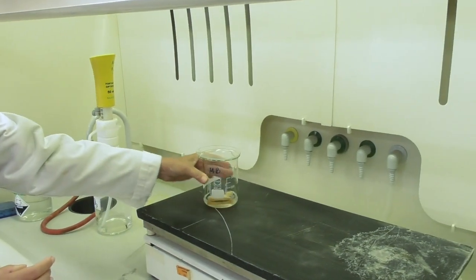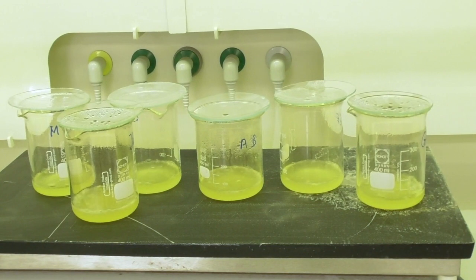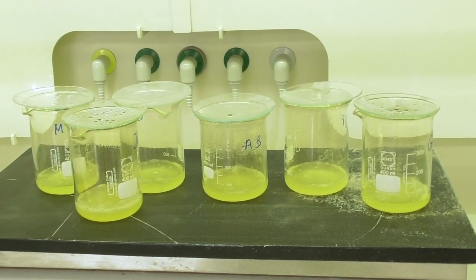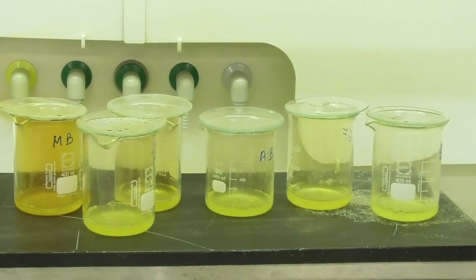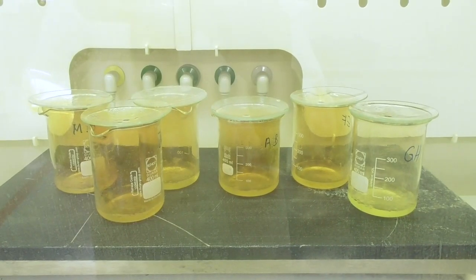I put the beaker on top of a hot plate and it will sit on the hot plate together with the other samples for about 35 minutes until the bread is fully dissolved.